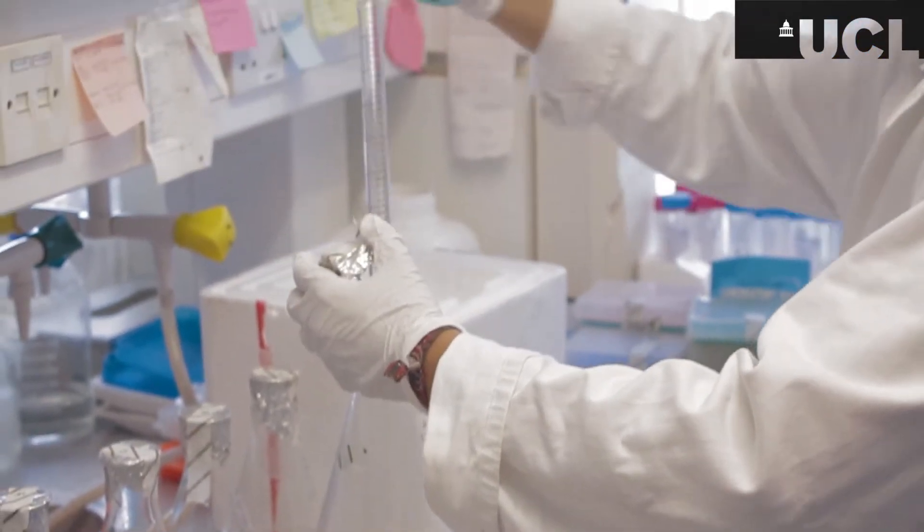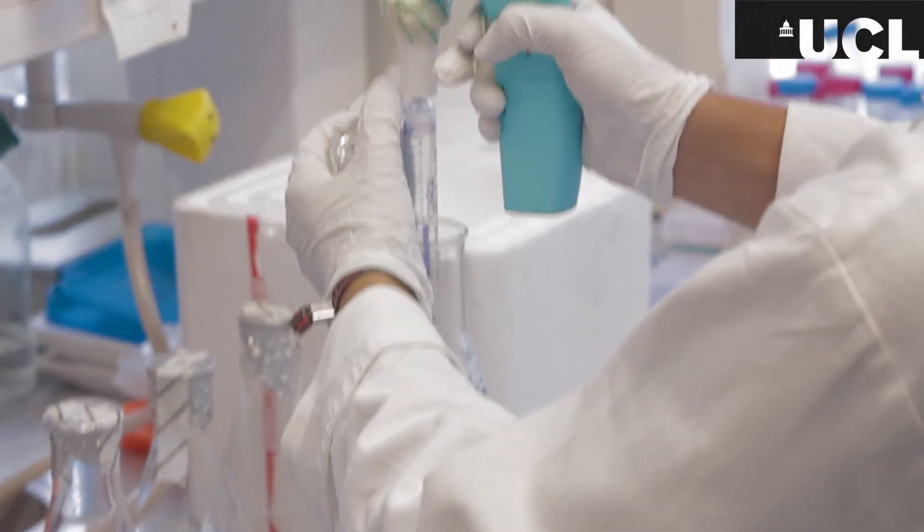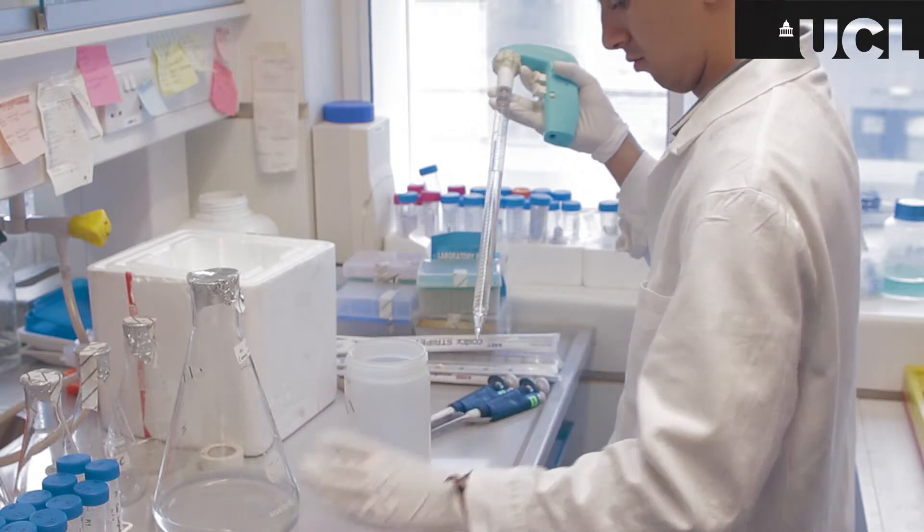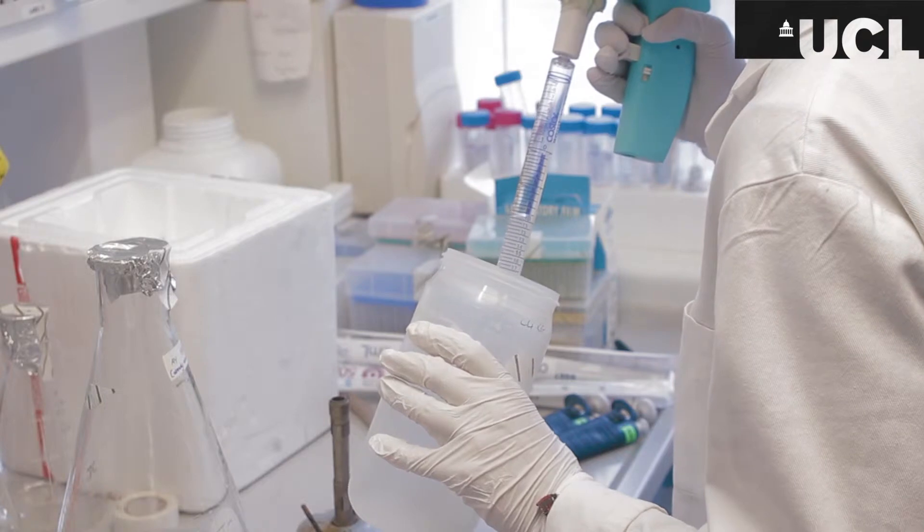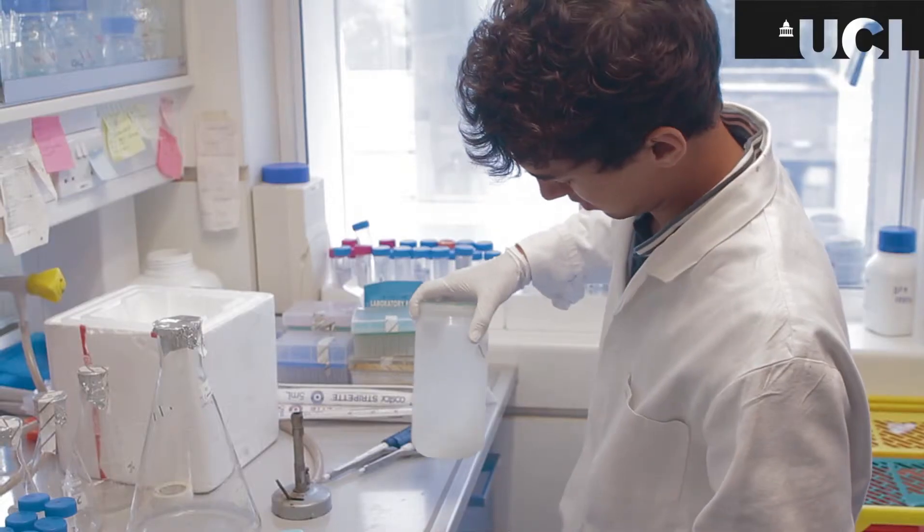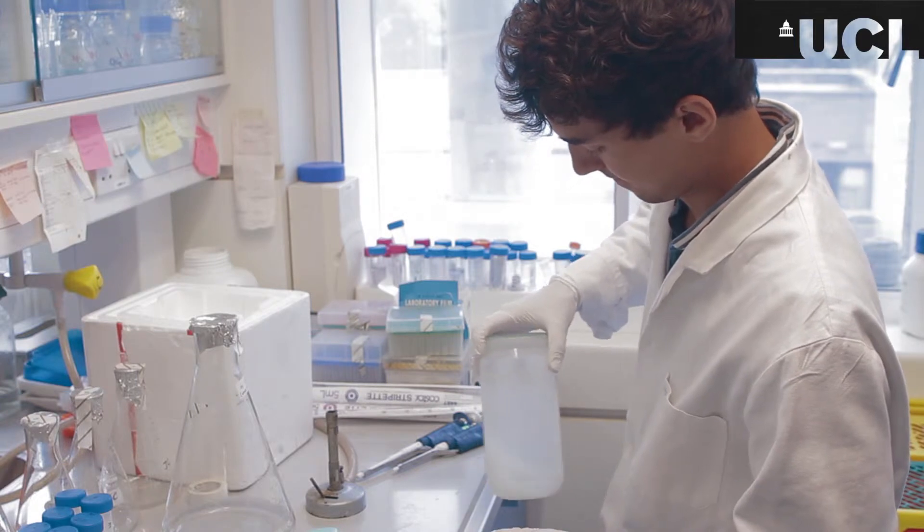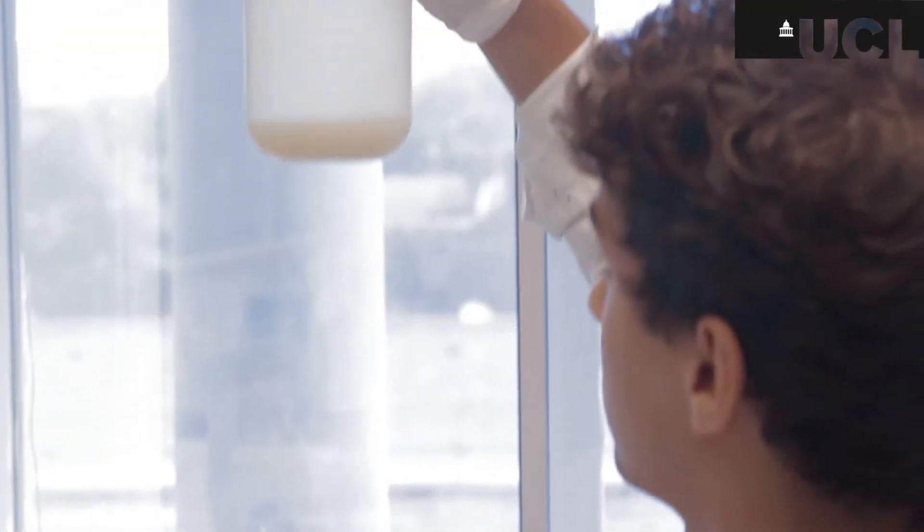So the cell pellet then needs to be resuspended and to do that I'm just taking off about 50 ml of the media and I'm just going to pipette that up and down over the cell pellet to resolubilize it. Now you have to be quite careful with resuspension obviously shaking too vigorously could disrupt the integrity of the cell and that would obviously be very detrimental to the experiment.